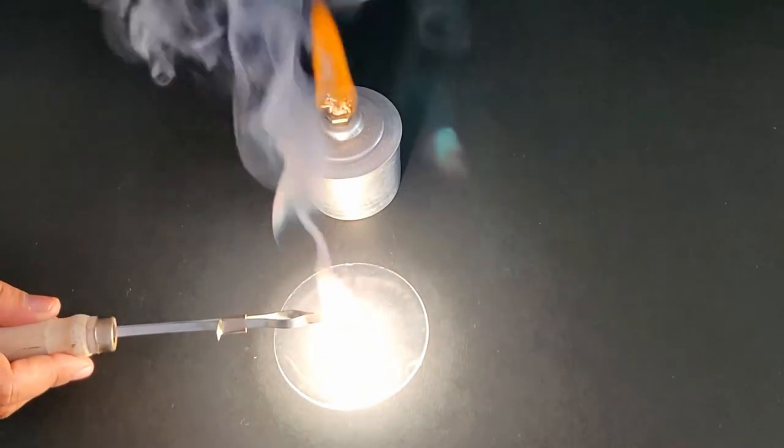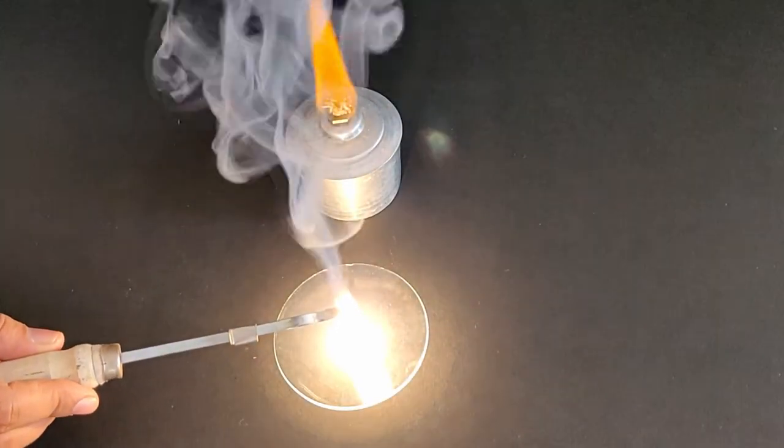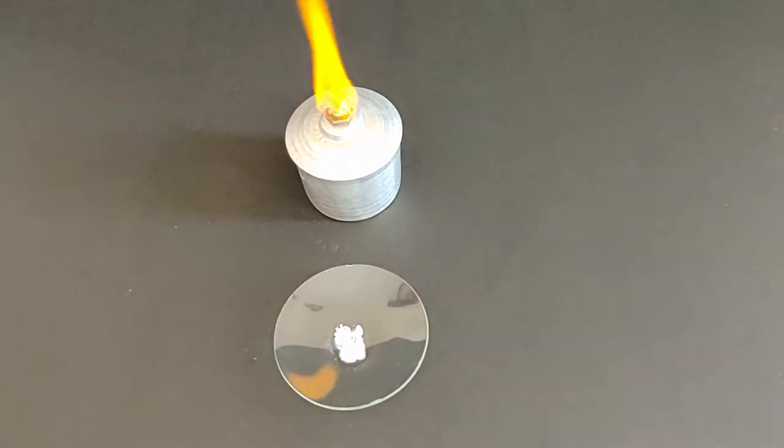Do not directly look at the flame as this can injure your eyes. Collect the ashes from the combustion in the watch glass.